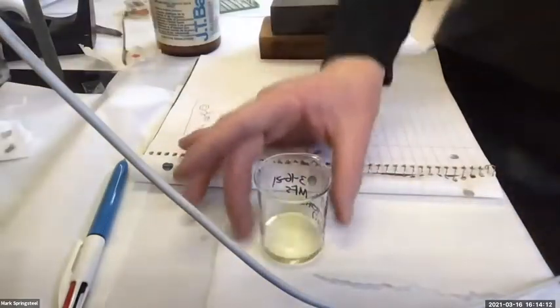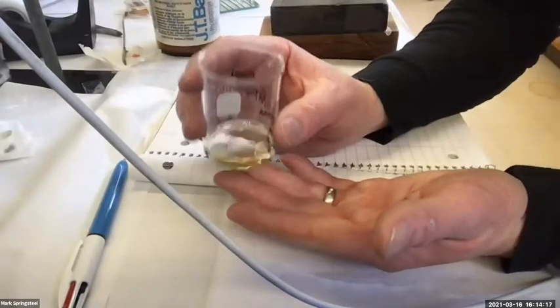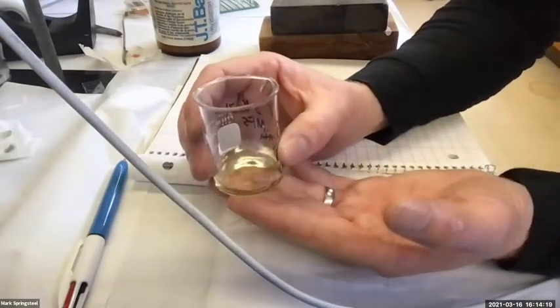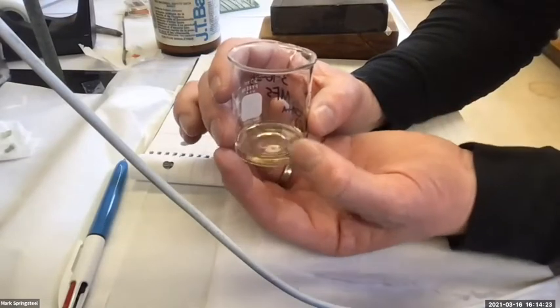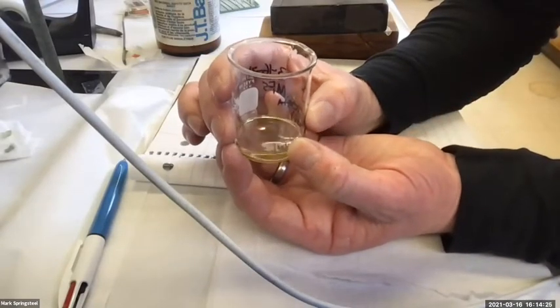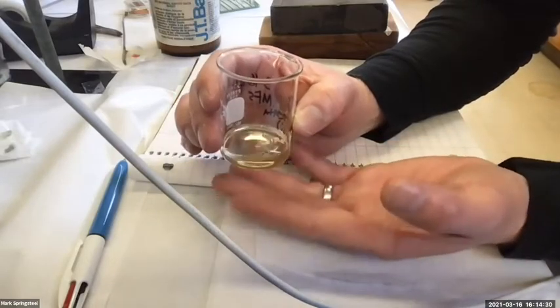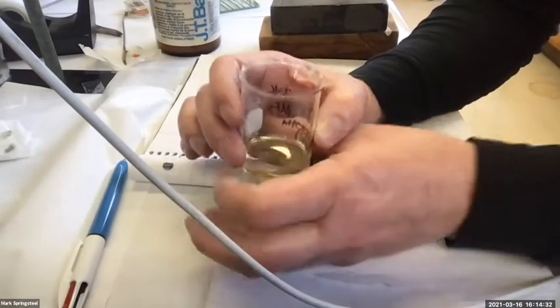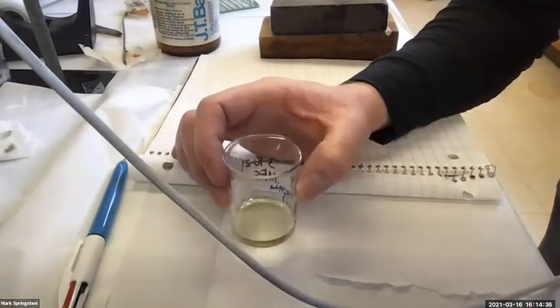All right, so now I'm just gonna let this guy evaporate. If I just hold it here for a while, it'll start evaporating pretty quickly. The boiling point of methylene chloride is 40 degrees Celsius. And as it evaporates, this outer glass will feel it get cold because of the evaporative cooling. And that'll slow down the evaporation. So if I want it to go a little faster, I can nest it in another beaker that has some warm tap water. So I'll go ahead and do that.